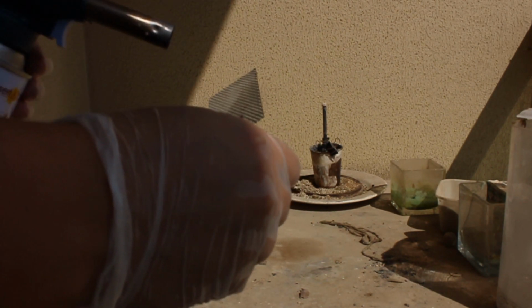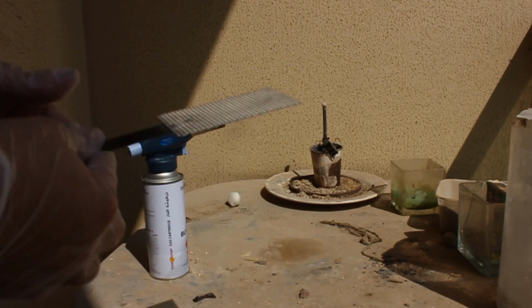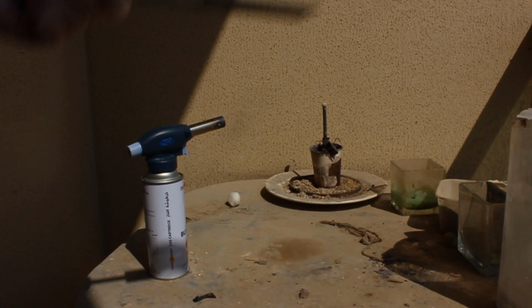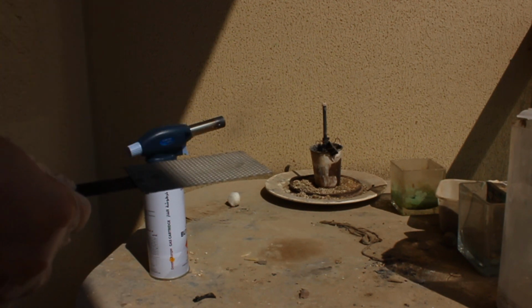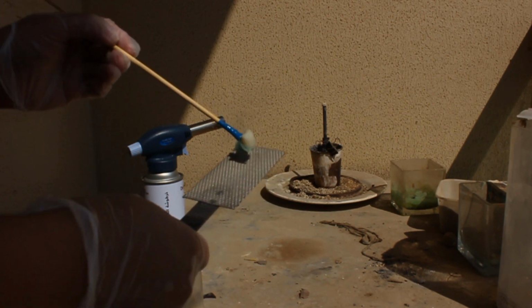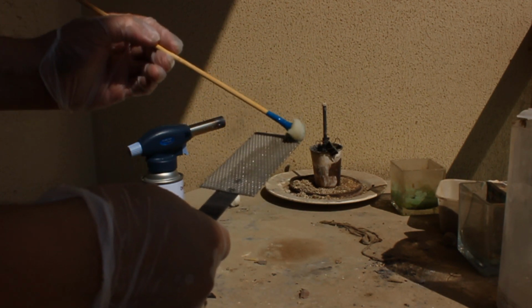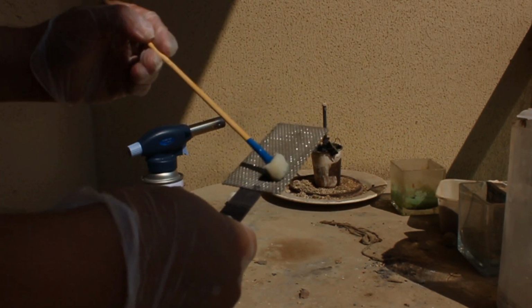And we're getting our nice matte gray color. Make sure that the flame is evenly spread across the surface. You can see the emission of white fumes of tin oxide and hydrochloric acid. Shake it around. So you've done that. You do another coat of your lovely mixture. Basically, you repeat this 20 times or so.